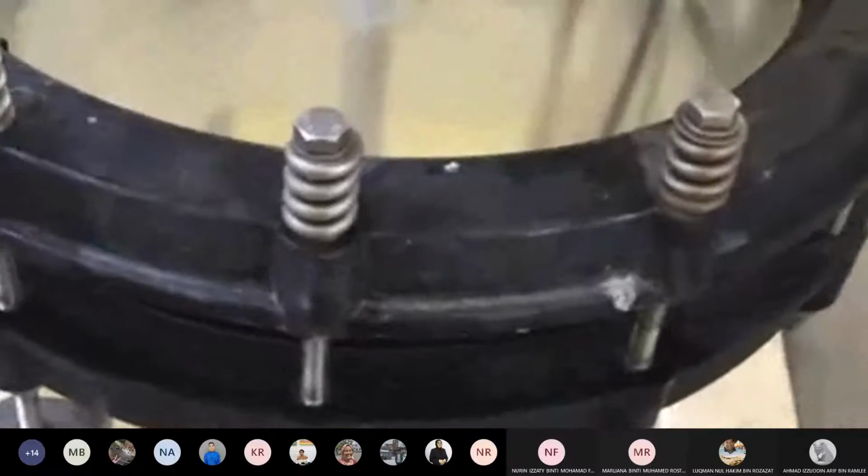Okay, next thing is, you know that in a batch reactor, the concentration is always uniform. Meaning, the concentration at the top, bottom, middle or anywhere in the vessel will be uniform, right? As well as temperature. So how do we do this? We do this by using a stirrer. So let me switch on the stirrer. If you can see, there's a stirring motion. Because the water is not very clear, you cannot see it, but if you can feel, there's a stirring motion, right? So I've switched on the stirrer.